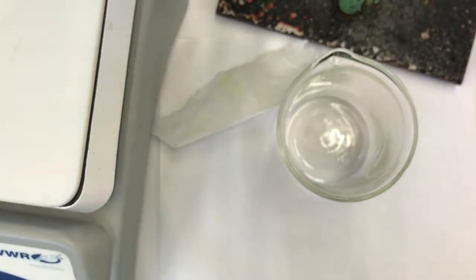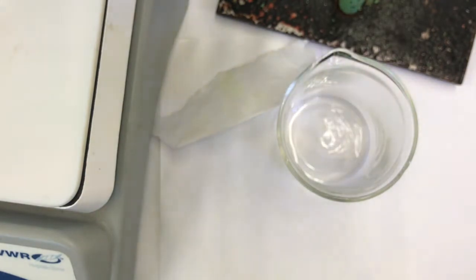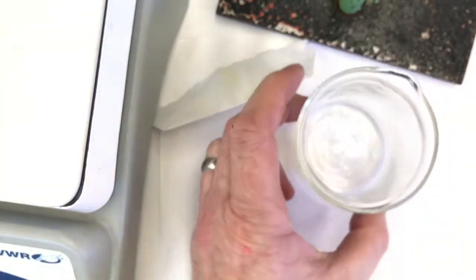And let's put the methylene chloride in. So I'll draw up some methylene chloride and just start shooting it in there, getting the wick wet. I just want to coat the bottom of the chamber. I don't need to go too high because it needs to be below the level of my spots. I can check it on the outside actually. Let's see if I did a good job. If I have this in there, yeah, it looks like it's going to be below the level of the spots to start. I think it looks good. I think you get a parallax error, but from my visual, it looks good.